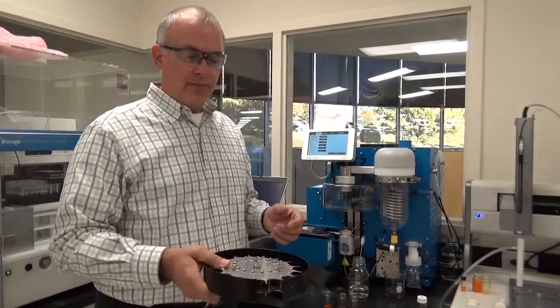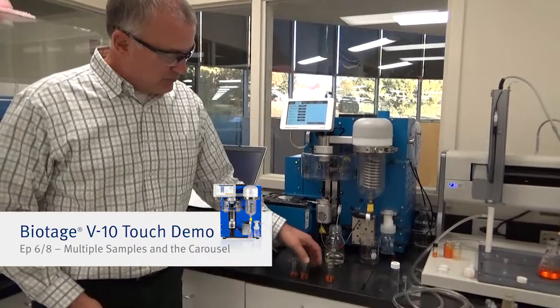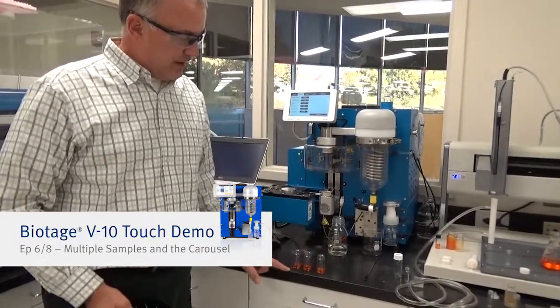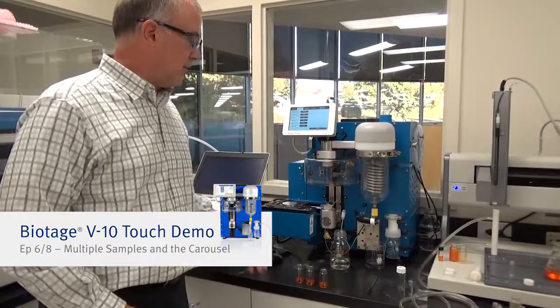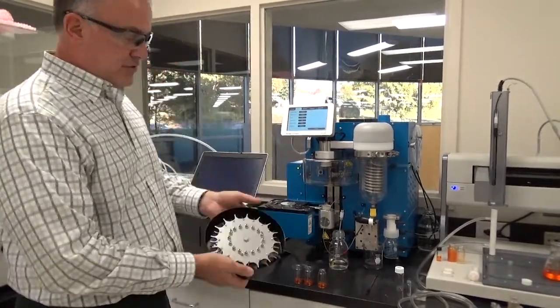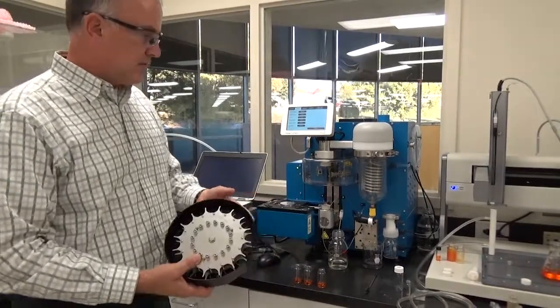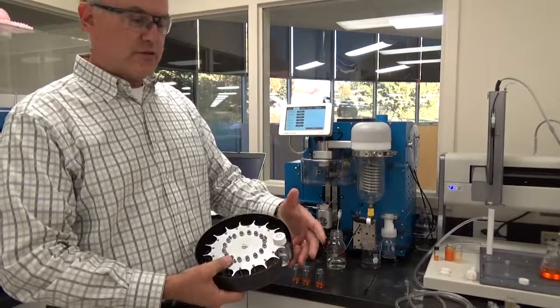All right, well, now if you've got 3 reactions, 3 different vials that you'd like to dry down, it's a good application for the carousel. Otherwise you're standing here and feeding this manually. There's a selection of these carousel racks. The 30 ml vials fit in here just fine, just like those.